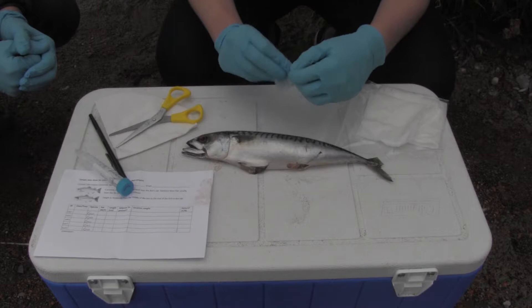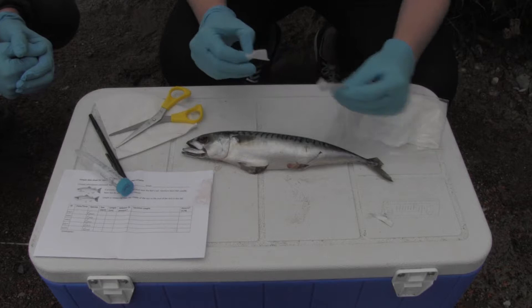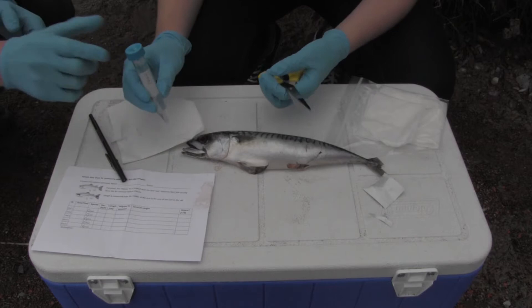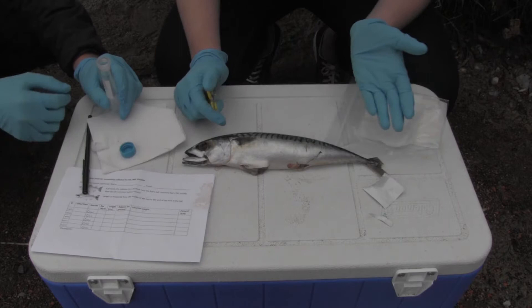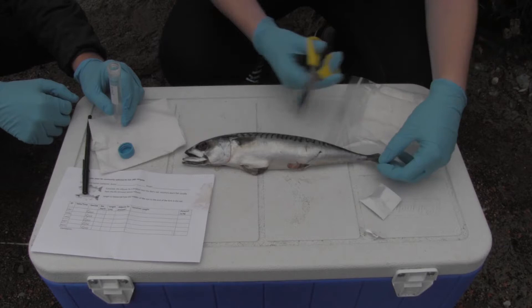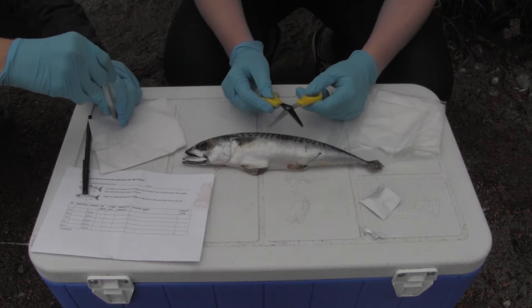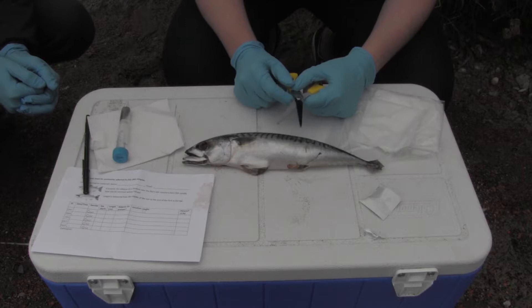After a minute, take an alcohol swab from the kit and wipe off any remaining bleach on the scissors, because we don't want the bleach to degrade any DNA in the fin clip that we're taking. Then take your preservation tube, select a fin on your fish that is in good quality, and cut about a quarter-sized piece of tissue. For example, I'm taking this from the tail fin here — simply cut off a sample and then submerge it in the preservative. Between fish, if you're sampling multiple fish at one time, you would again bleach the scissors and then alcohol swab them once more.